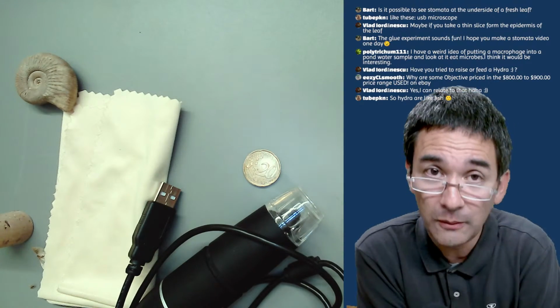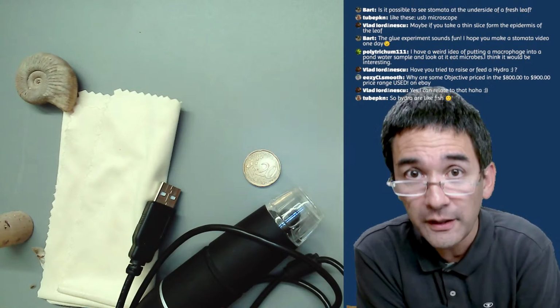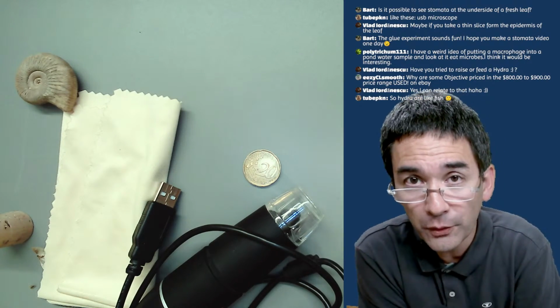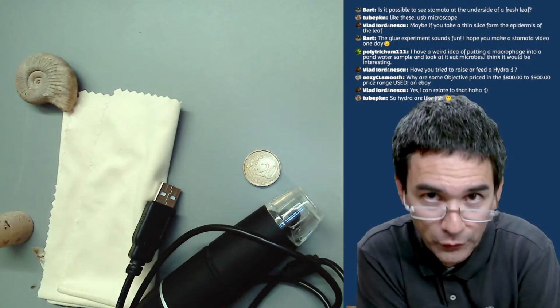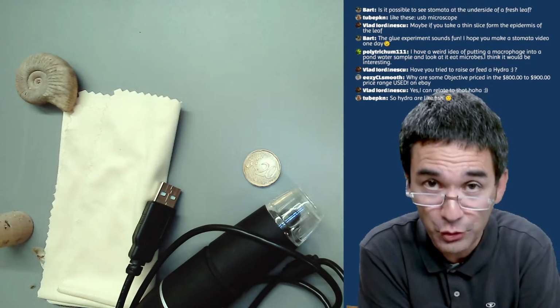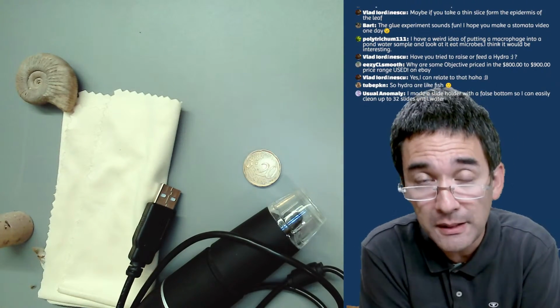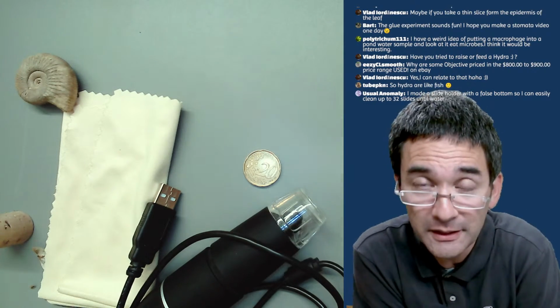Well, first of all, if a microscope objective has been well taken care of, then it won't age. That's number one. If, for example, I'm a research organization or university, and I have a very expensive brand microscope that I've had for many years, let's say 15 or 20 years, and I need to upgrade it, it can be that the company does not have the system available anymore.